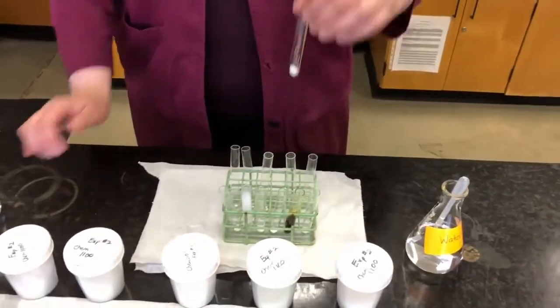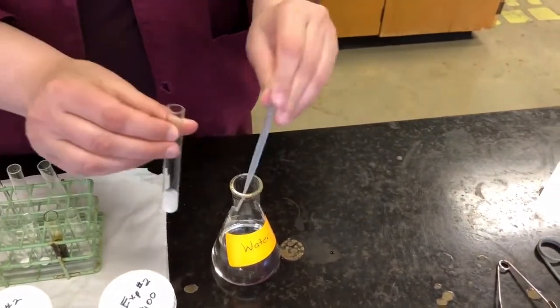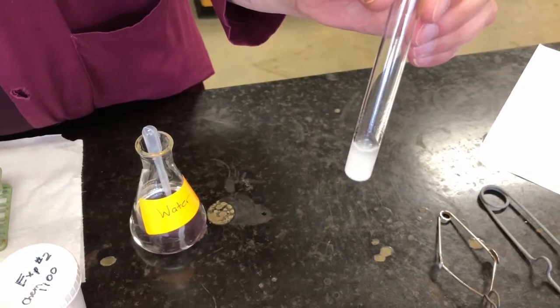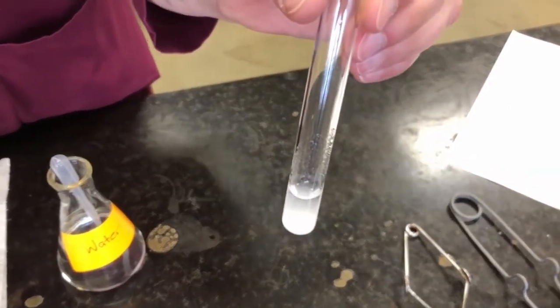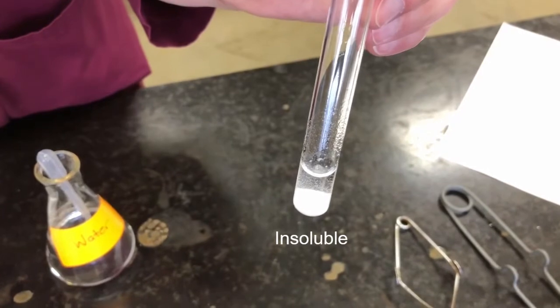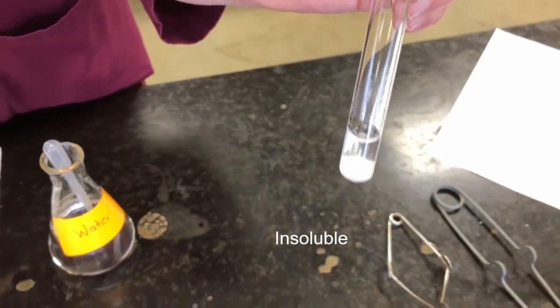Our next sample is chalk. And again, maybe you know the answer to this one, maybe you don't. Let's see, is chalk soluble in water? So it looks like it dispersed a little bit when I added the water, but if I just let it sit here, you can see that it's starting to settle out. It's falling back down to the bottom of the test tube. Okay? So that tells us that it is insoluble, meaning that it does not dissolve in water. So chalk is insoluble.